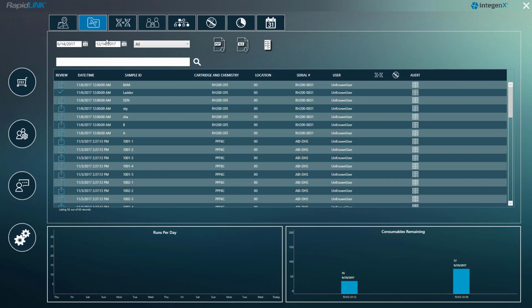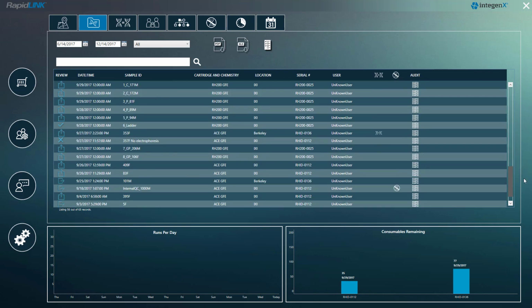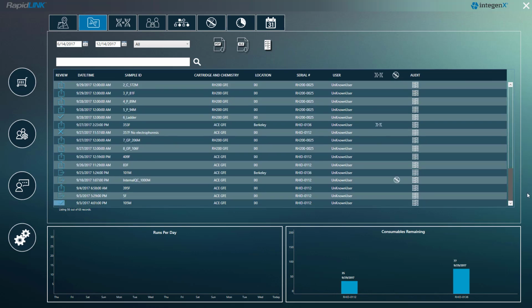Any profile in RapidLINK, even if it's still pending review, is being matched against the elimination database. When RapidLINK detects a match, it displays an icon in this right column. Click on the icon to open the report in PDF, and you can see what that sample matched to, as well as the likelihood ratio of that match.